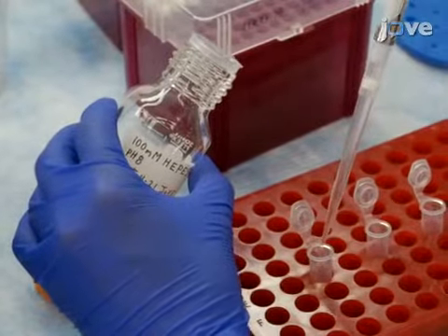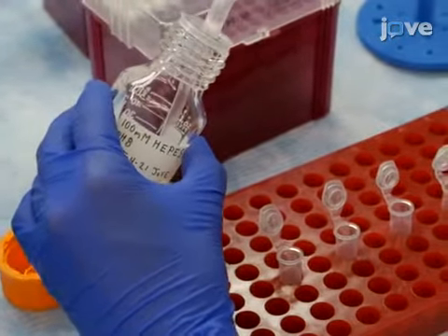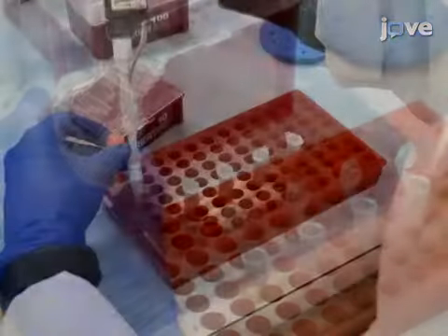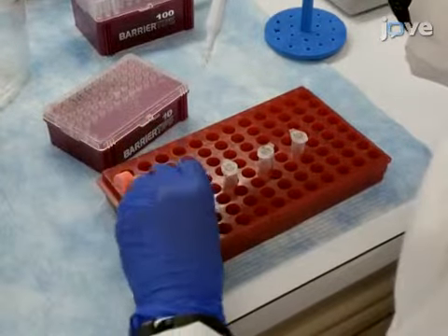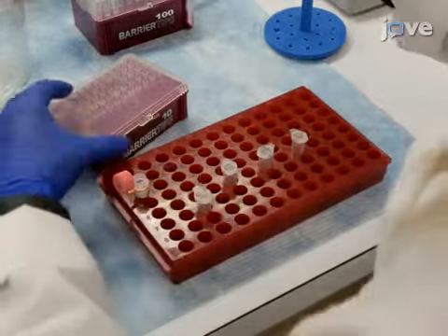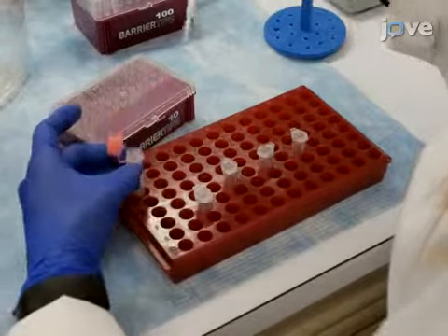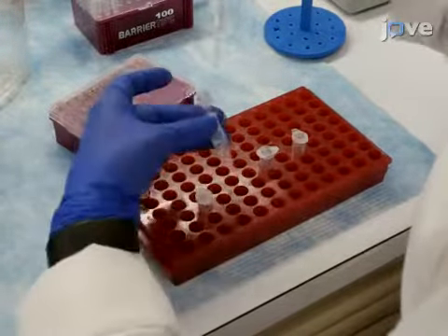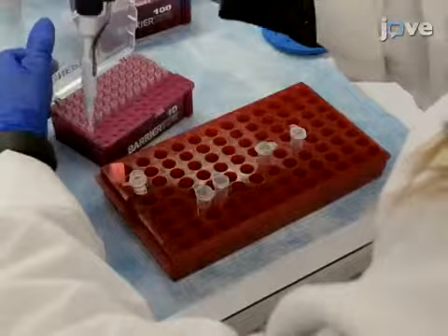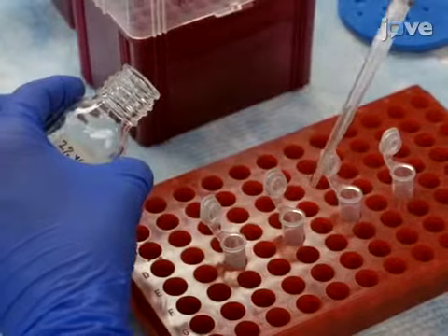For each of the samples, add 482 microliters of 100 millimolar HEPES, adjusted with sodium hydroxide, so that the final urea concentration is 1 molar. Next, tryptically digest the proteins into peptides. Add 8 microliters of 0.5 micrograms per microliter sequencing grade modified trypsin to each sample that contains cell lysate. Then, incubate the sample at 37 degrees Celsius for 18 hours. Following incubation, add 440 microliters of 2% volume-to-volume formic acid.